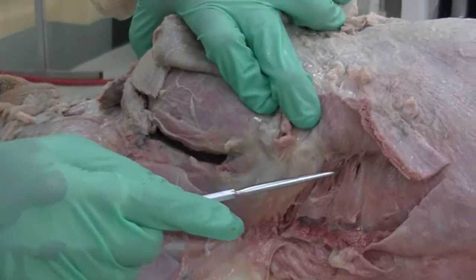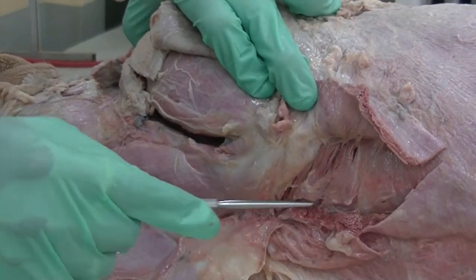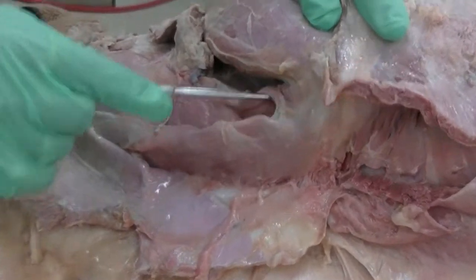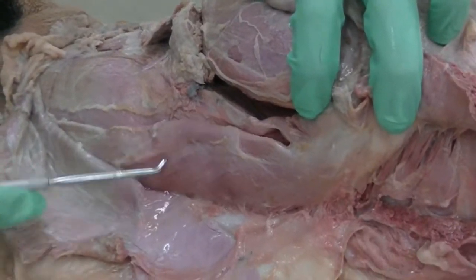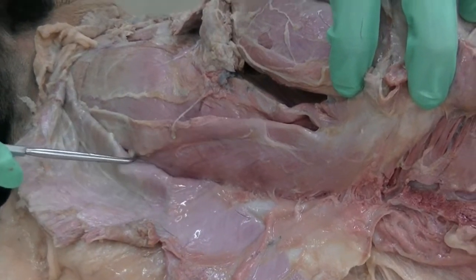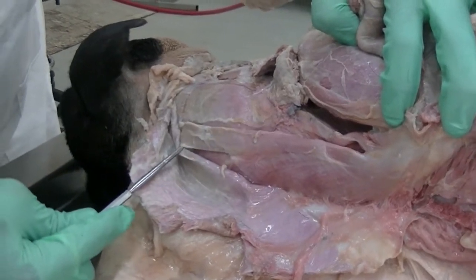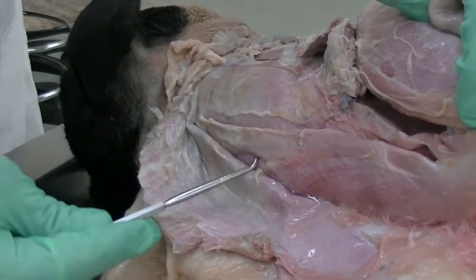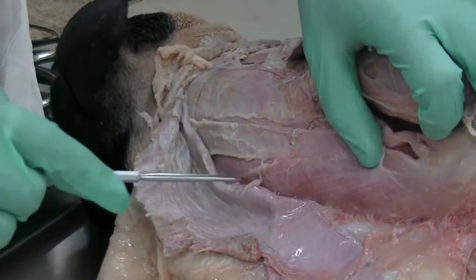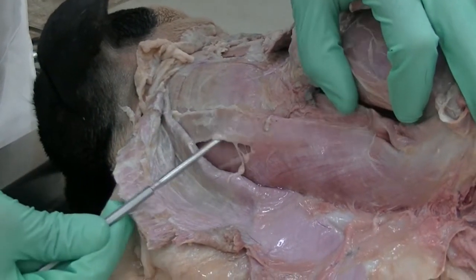Well, we see the muscle underneath the trapezius, that is your rhomboideus. This part is associated with the thoracic region, so it is rhomboideus thoracis. The part of the rhomboideus which continues further cranially, as long as it is associated with the neck, is called rhomboideus cervicis, and then the part of the rhomboideus which continues even more cranially to get attached to the skull is called rhomboideus capitis. So the thin strip-like muscle which can be differentiated more cranially from this rhomboideus cervicis, that is the rhomboideus capitis.